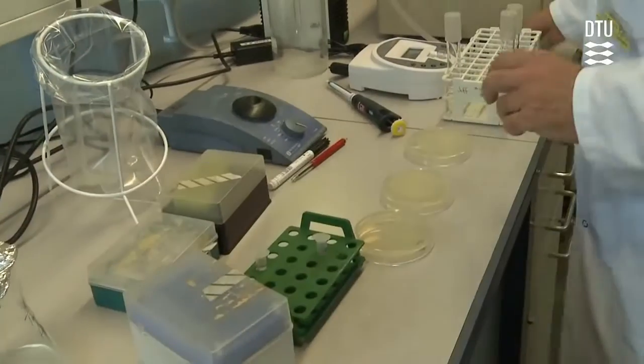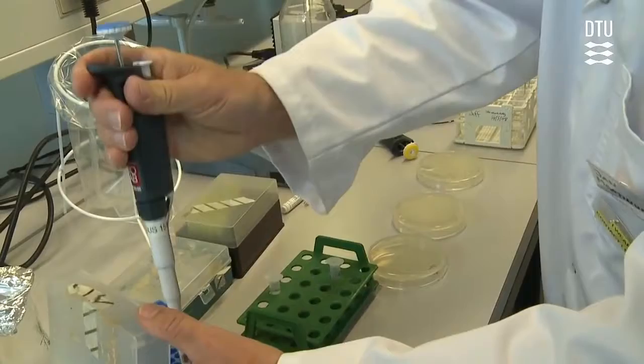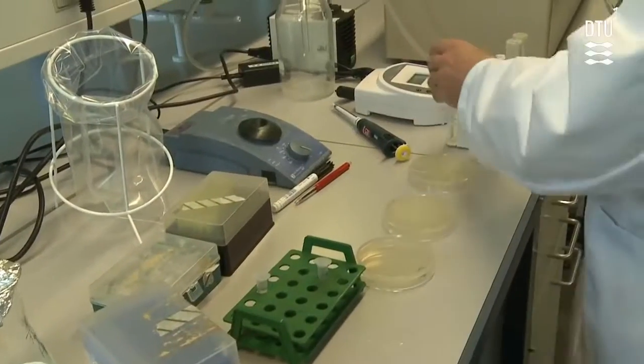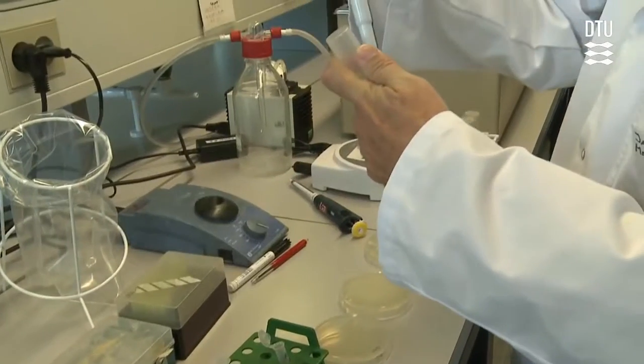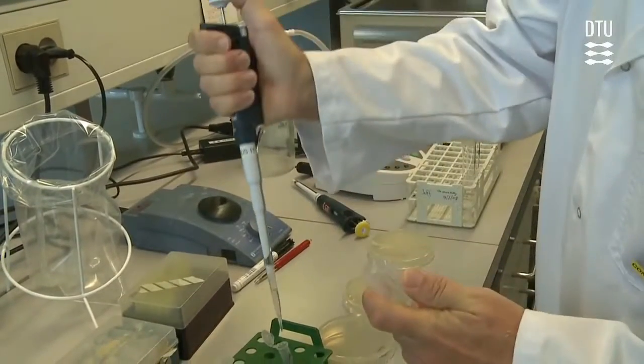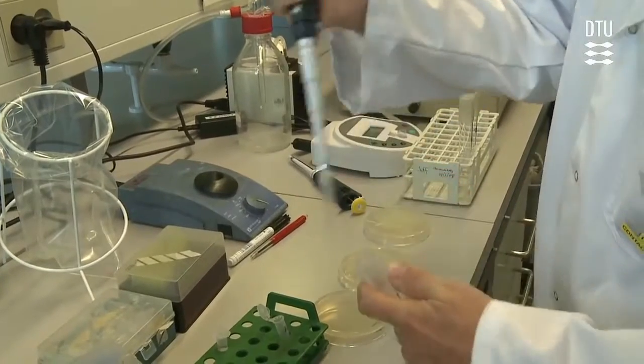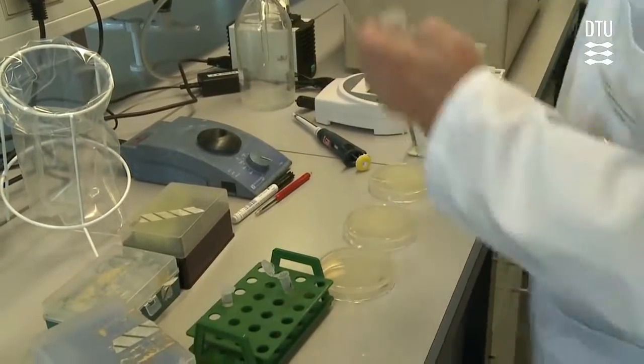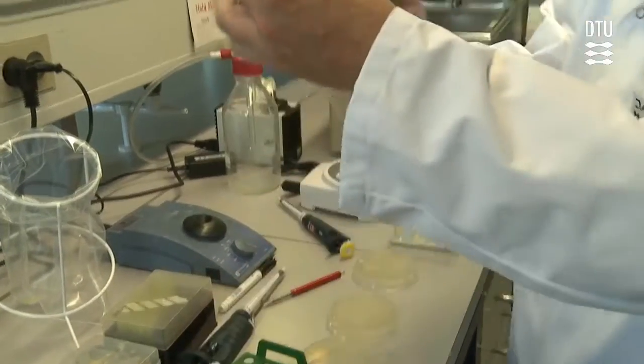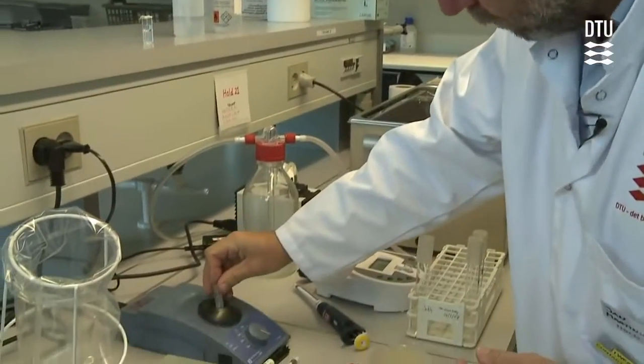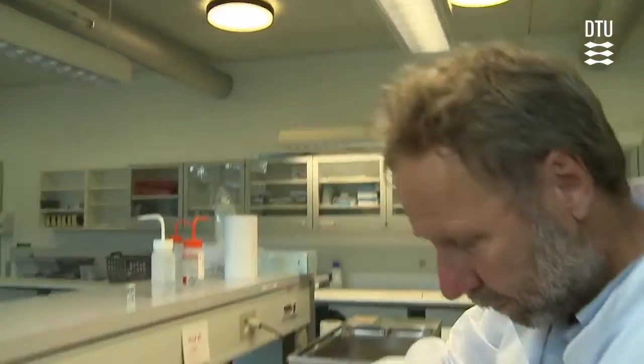It's time to re-suspend the cells. For that you take physiological salt water at 1.5 milliliters to the tube. You can then re-suspend the cells either by shaking or by vortexing it in the vortex mixer.